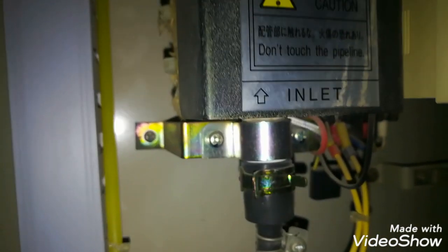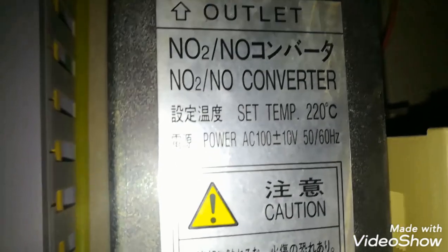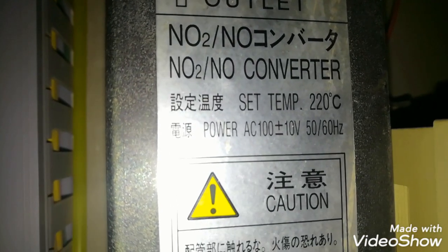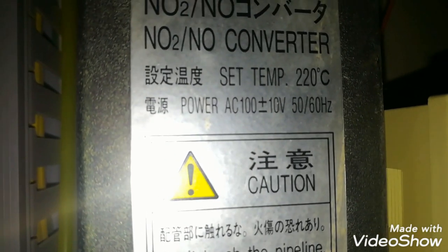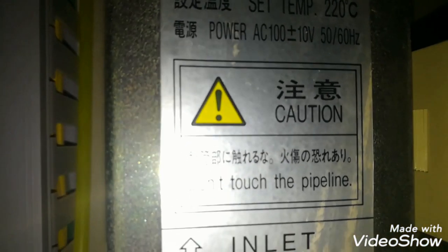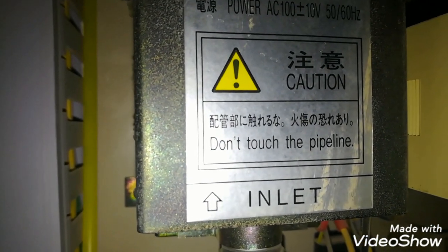As you can see, the inlet tube is connected and the outlet tube is connected to the NO2 to NO converter. Its set temperature is 220 degrees centigrade and its power is 100 plus or minus 10 volts. At the inlet we supply NO2 gas, and at the outlet it will give us NO.